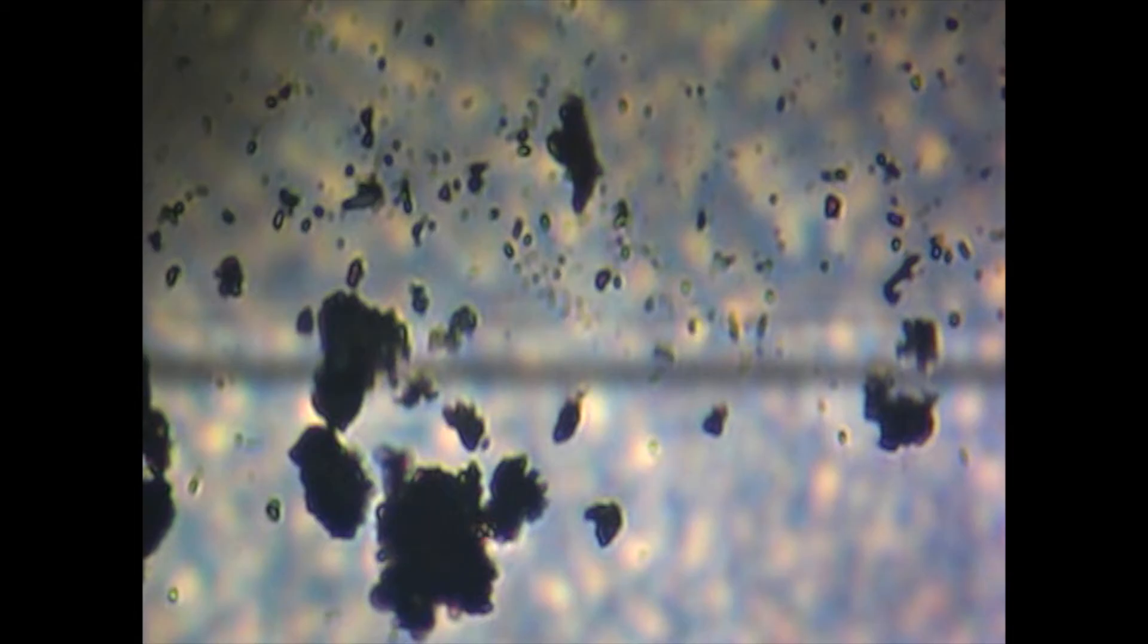This is the surface of the ground glass diffuser screen covering the light bulb in the base of the microscope. Without this screen you would merely see the actual filament of the bulb, which obviously you don't want.